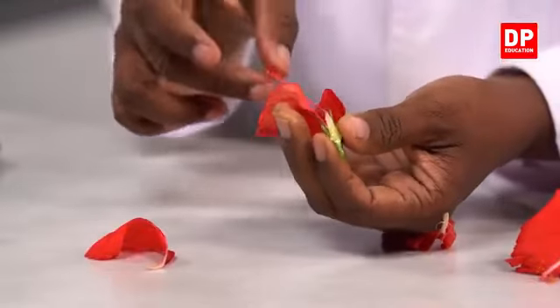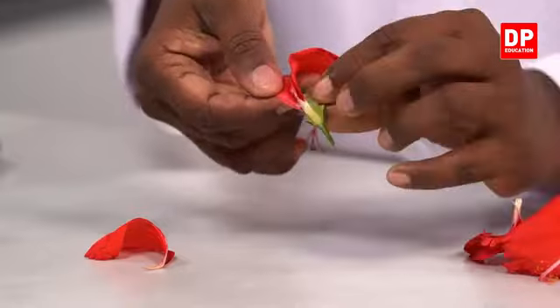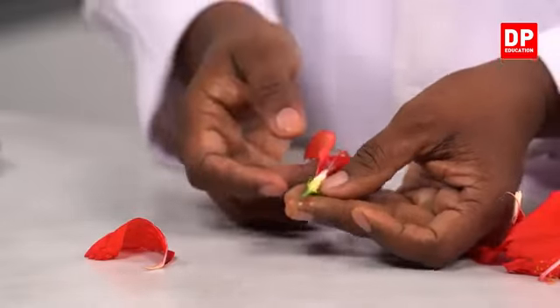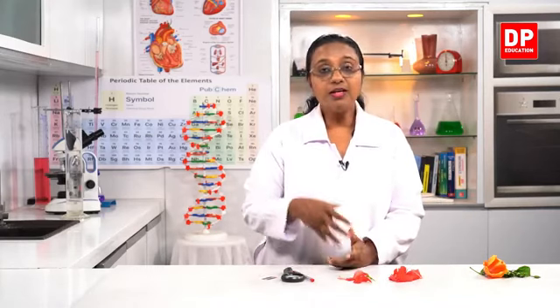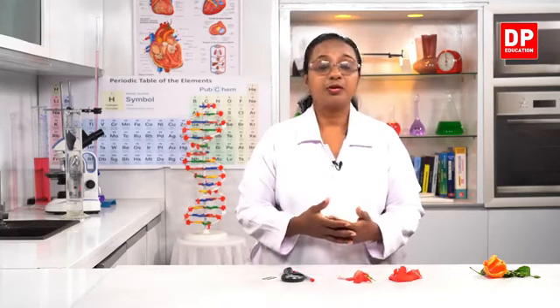So here with one petal you can see. Can you all see the whorl-like arrangement there? Those are the different parts of the flower. In a flower, the important parts: the stalk, then we have the pedicel, then we have the sepals and petals. Sepals make up the calyx, petals make up the corolla.